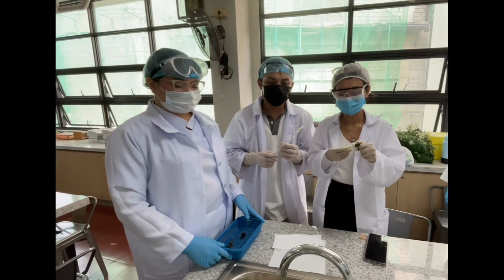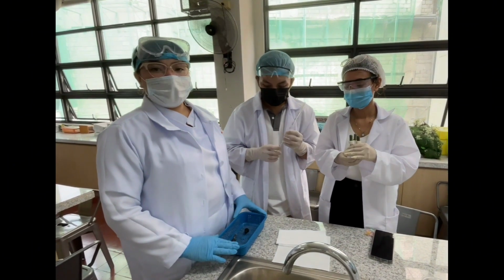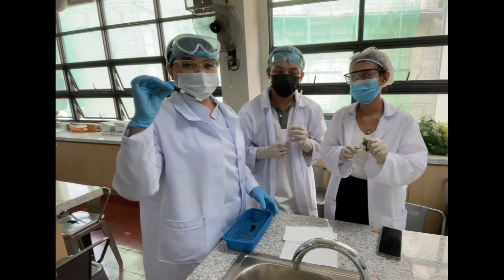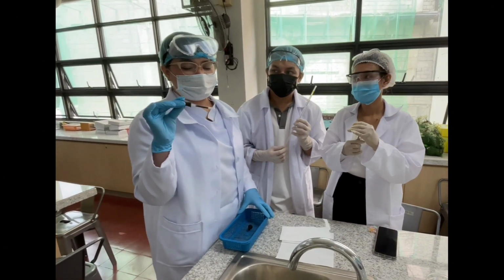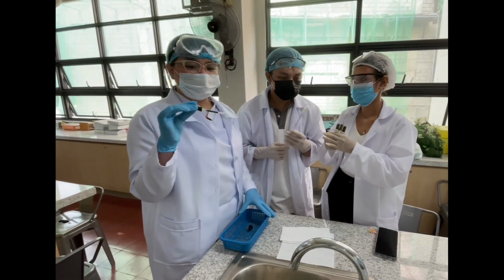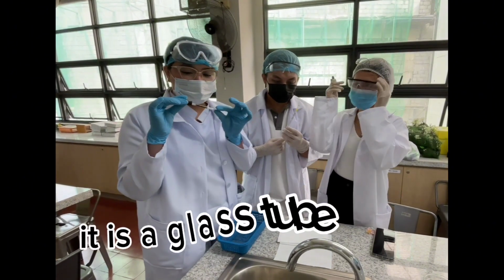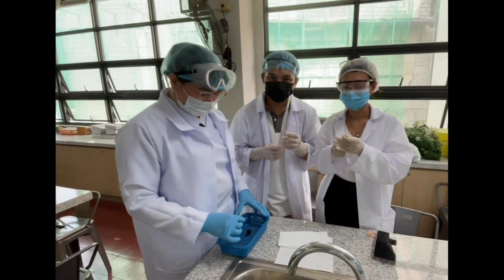So hello again guys, we are now at station 2 to explain what these equipments are. First, this one is a Pasteur pipette. It is also called a dropper. It is used for transferring liquids or samples in laboratory workflow. It is a glass tube with a rubber bulb on top.